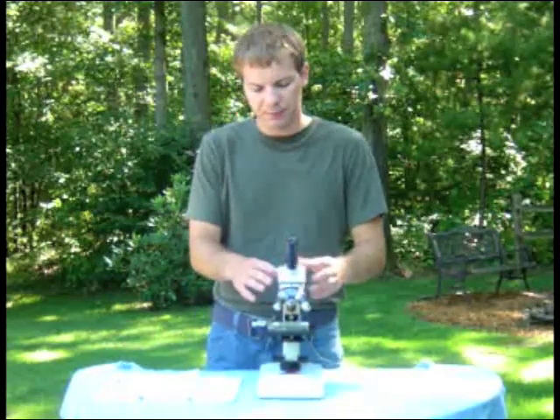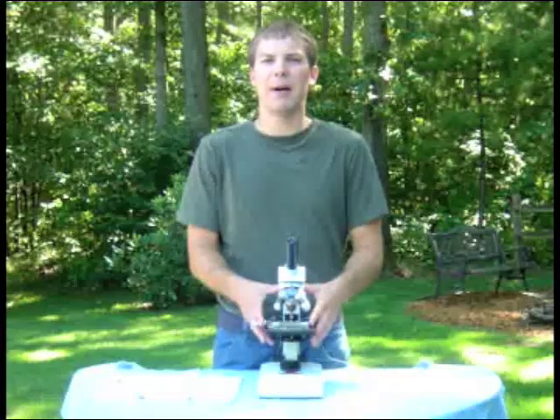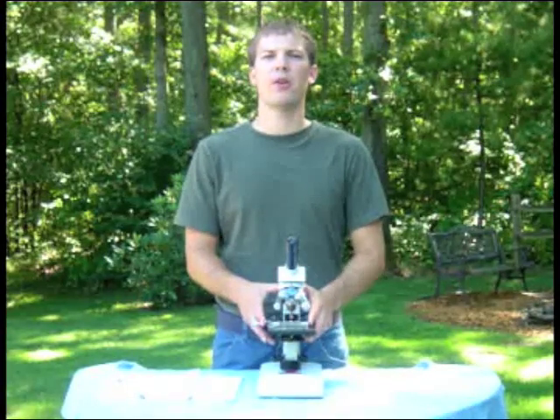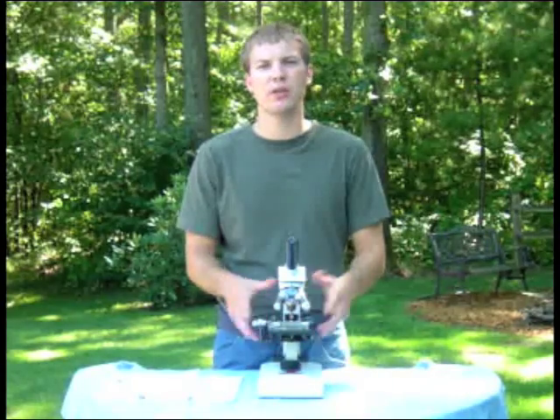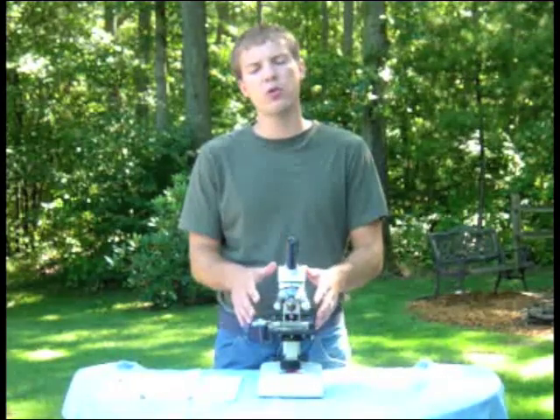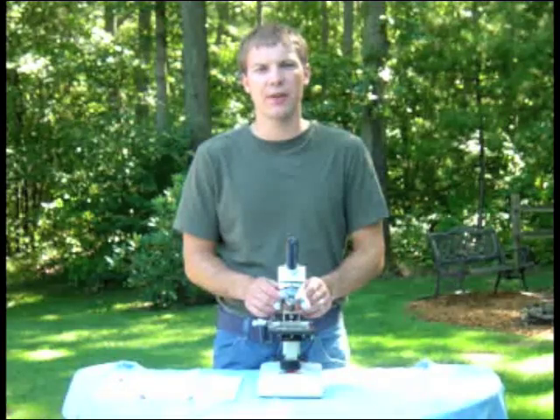We have two things. First of all, this is called a compound microscope. You probably remember from elementary school that compound means to multiply. So there are two things that we're multiplying together.